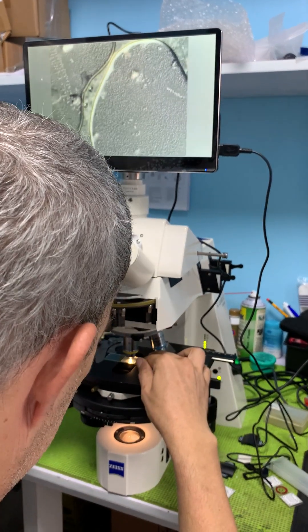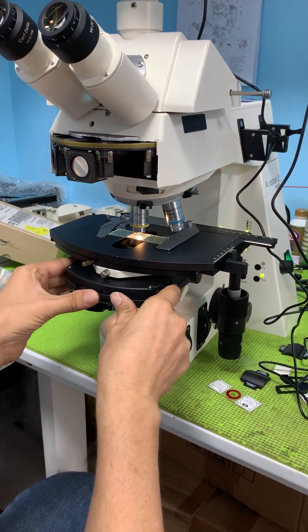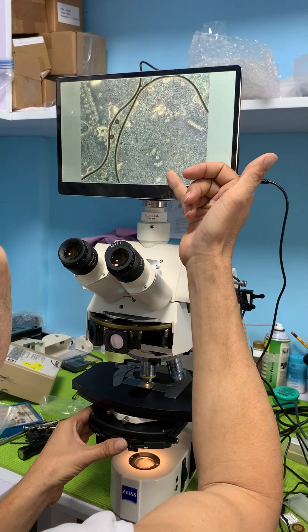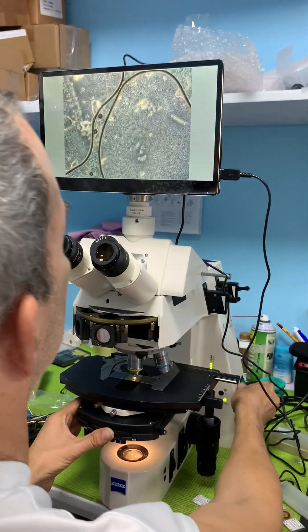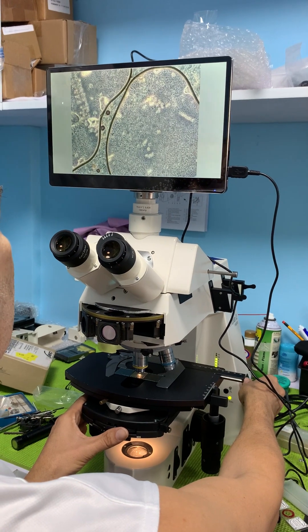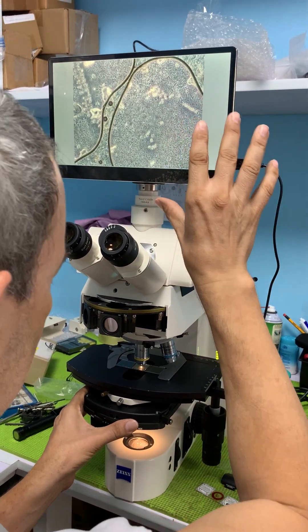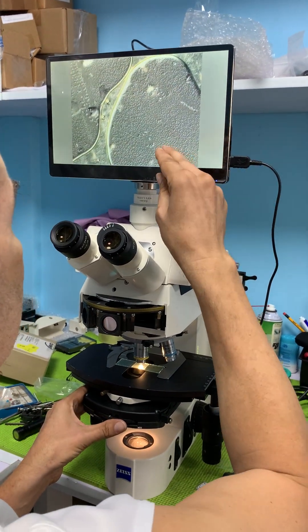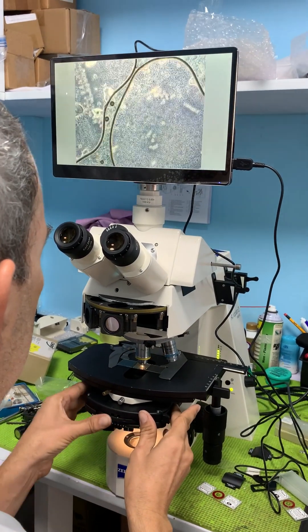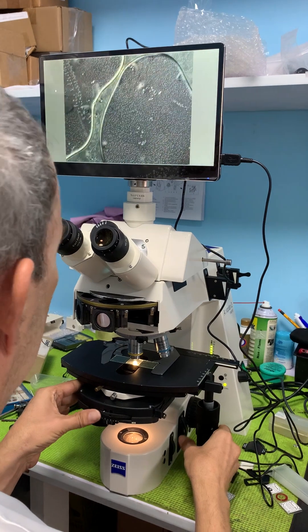This objective is a phase Ph1, so let's switch over to phase. We're on phase now — phase is nice but it leaves a lot to be desired. Now I'm going to switch it to DIC, and then back to phase quickly so you can see the difference. Now back to DIC, and let's move to the epithelial cells.